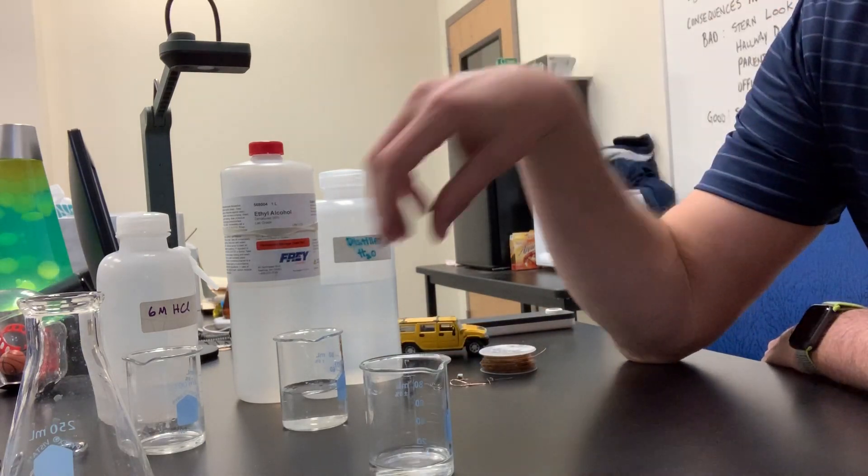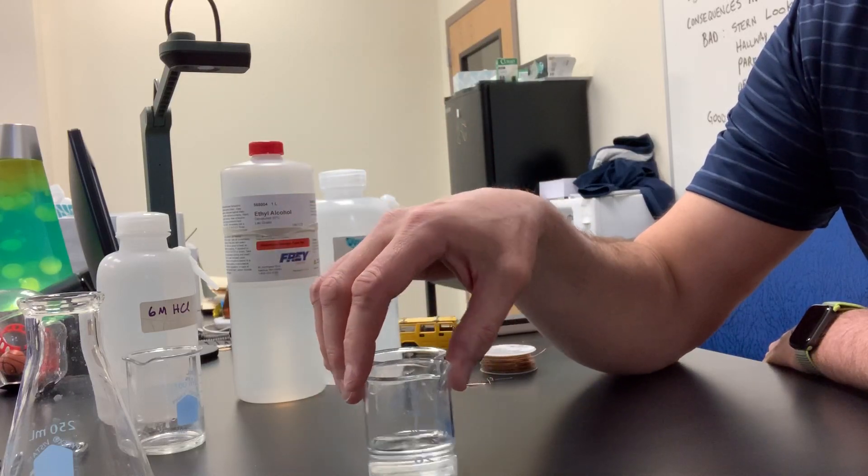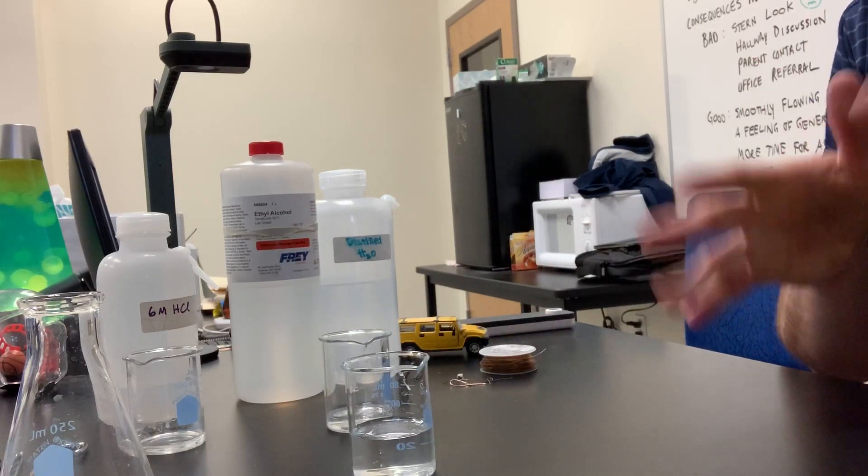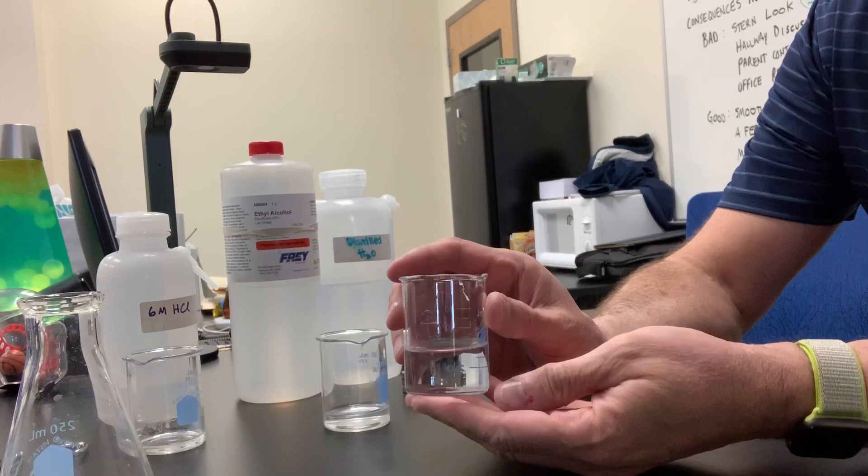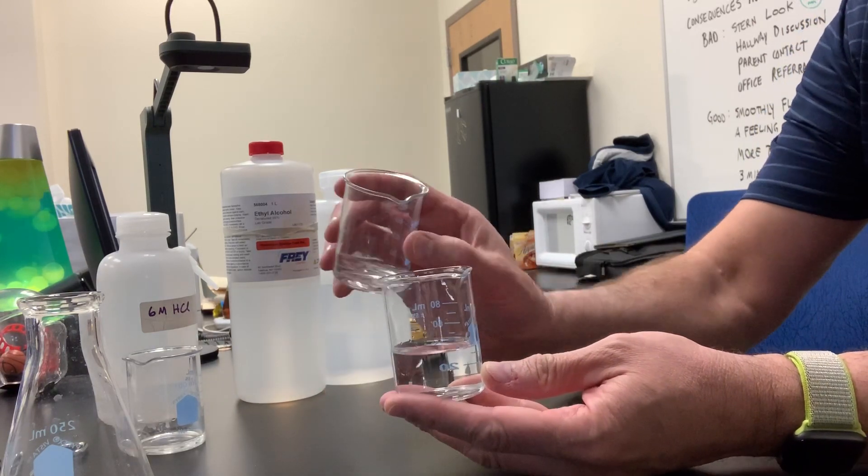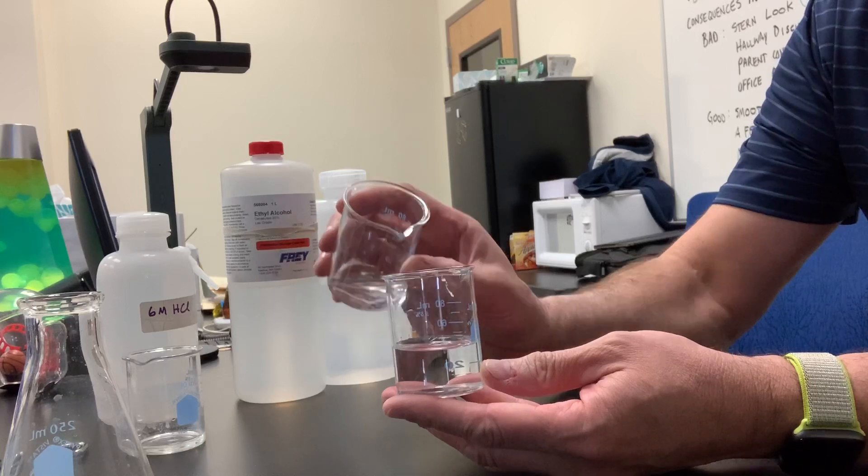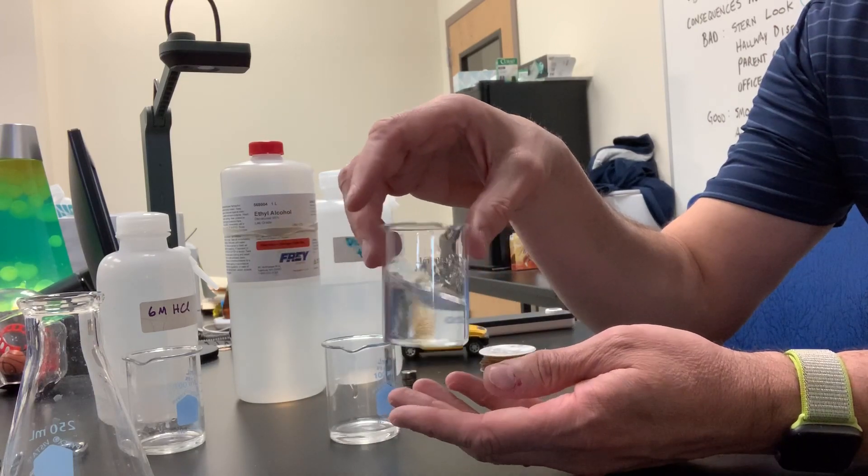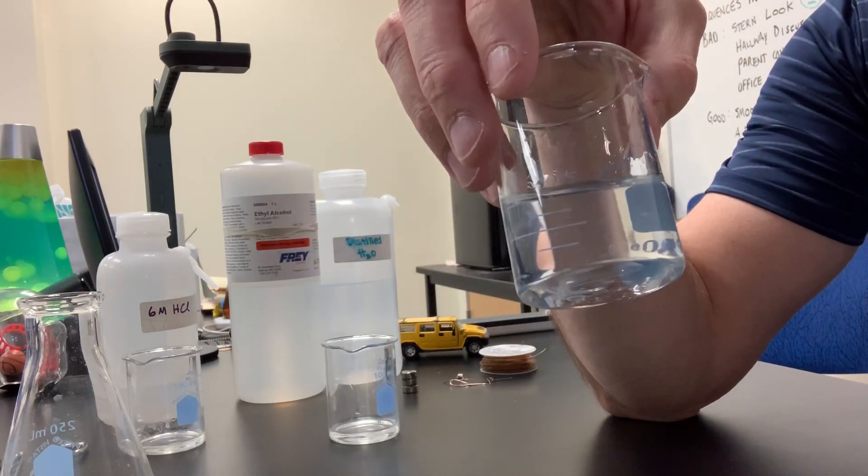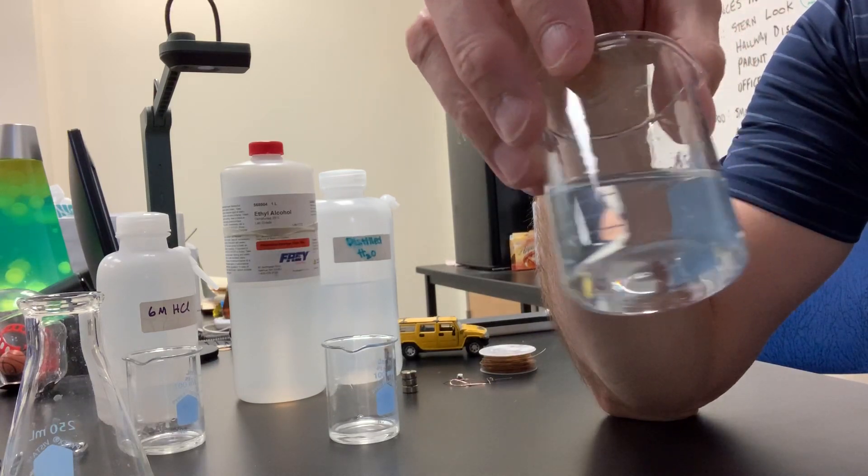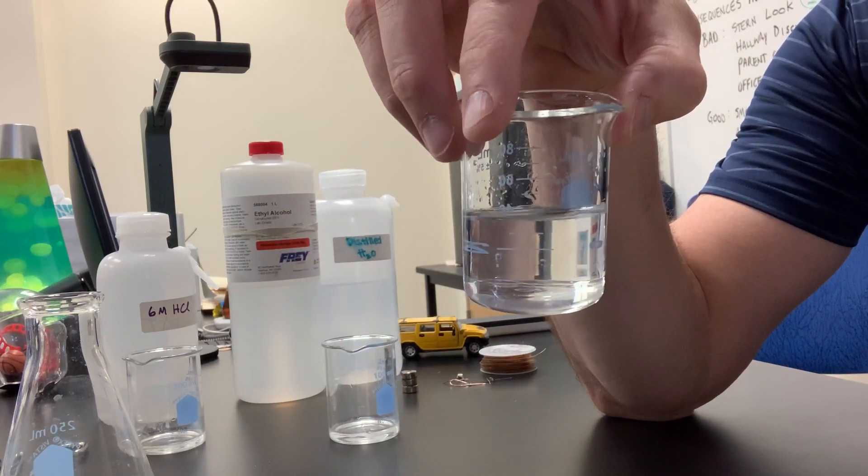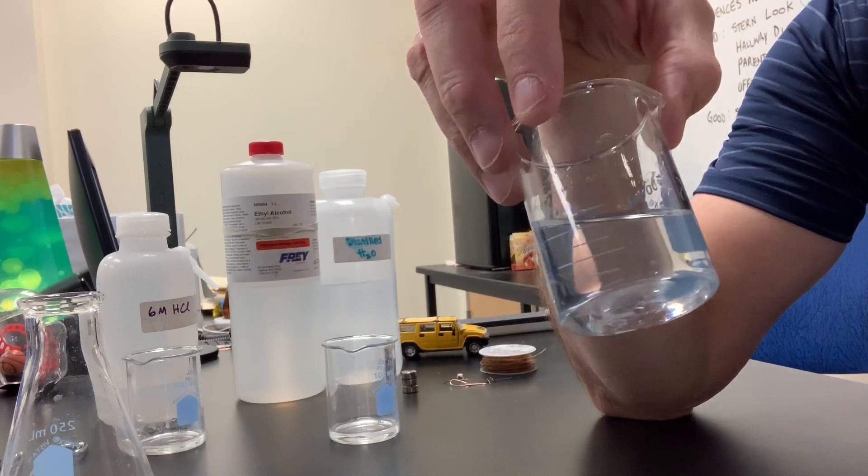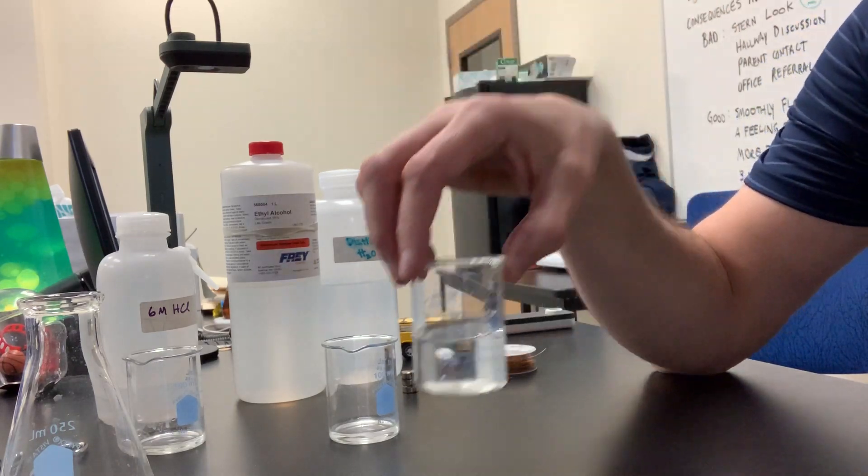How about this? Let's see if it's soluble in water. Here is my beaker of water that I've had for a little while. Now, something that's soluble in water, and that's another liquid, we like to use the term miscible. We say it's miscible in water. It's sort of a fancy term for soluble in water. How do you tell if two liquids are miscible in each other? Well, if I pour some alcohol into the water and swirl it around, I don't see layers like I would if I had put oil in water, do I? Yeah, the alcohol is miscible or soluble in water. So it turns out a property of alcohol, ethanol, is that it is soluble in water or miscible in water.